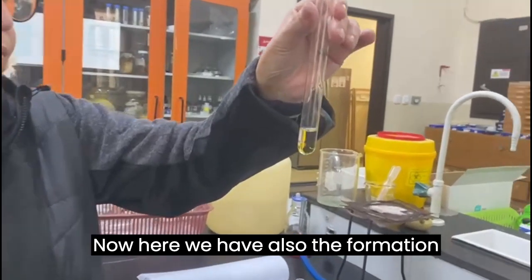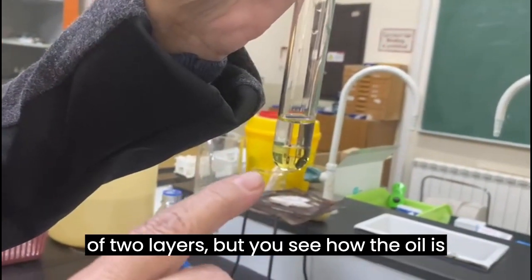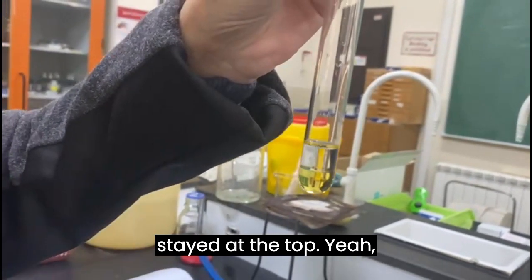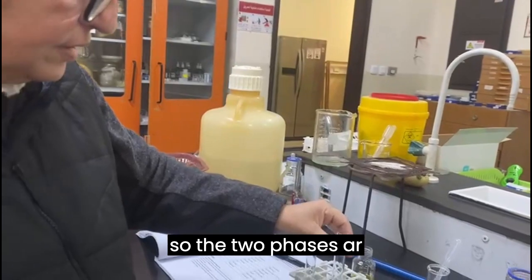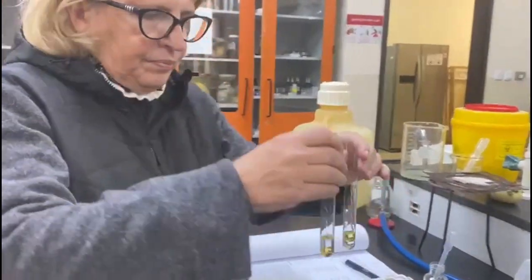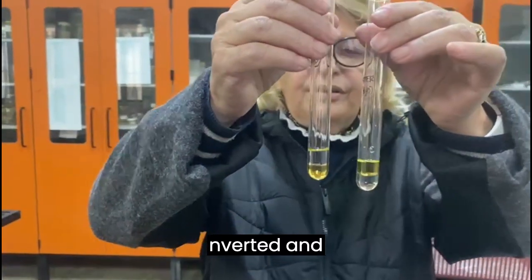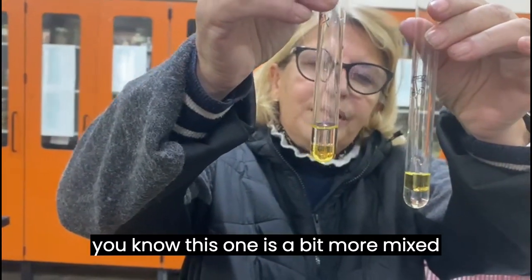Now here we have also the formation of two layers, but you see how the oil has gone at the bottom while the xylene stayed at the top, yeah? So the two phases are inverted, and you know, this one is a bit more mixed than the other.